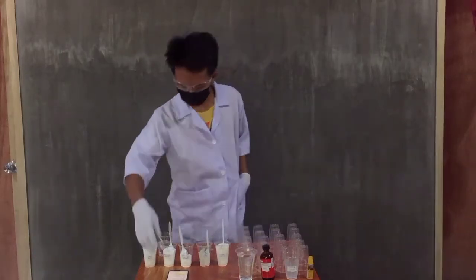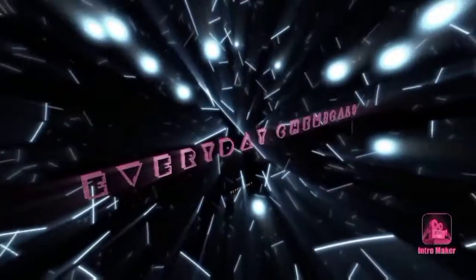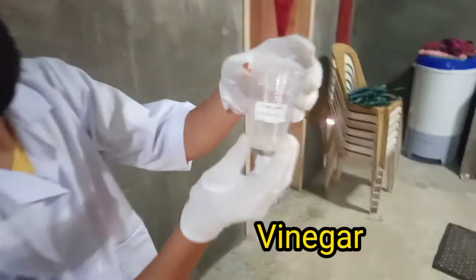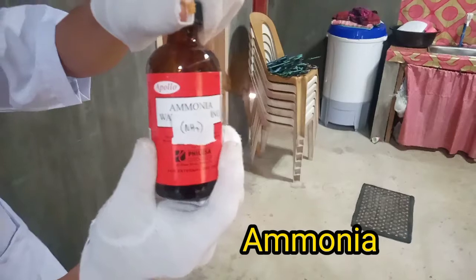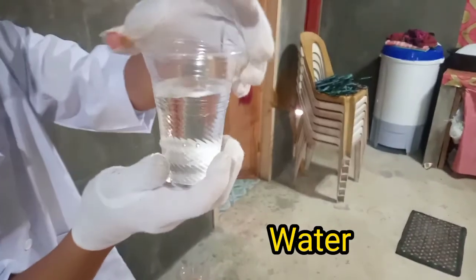Good day everyone. Today we will be having a qualitative analysis of everyday chemical experiments. This is the vinegar or C2H4O2. The next one is the iodine or the betadine. And this is the ammonia or NH3. Our water or our H2O.